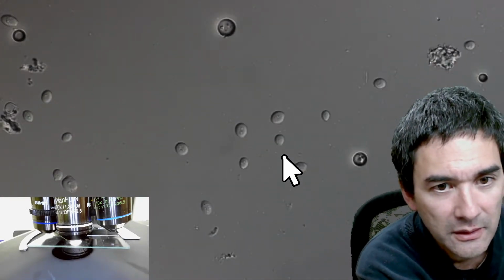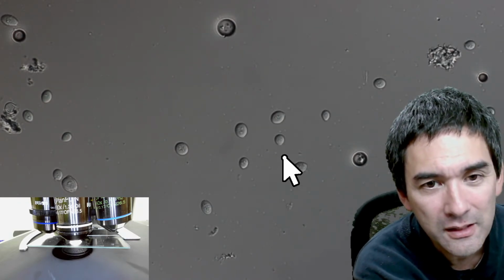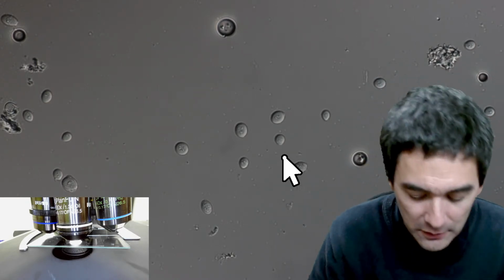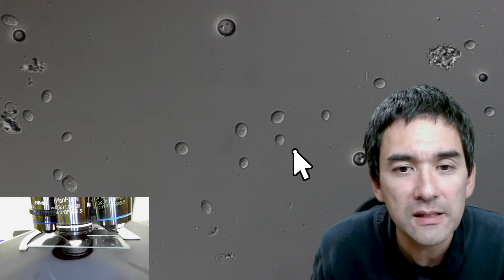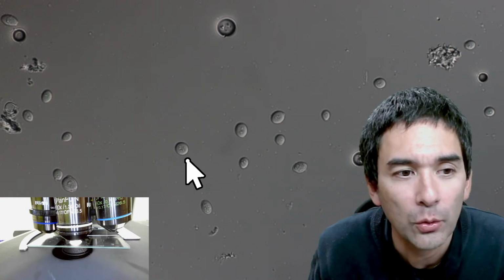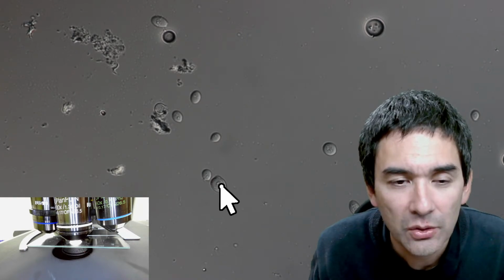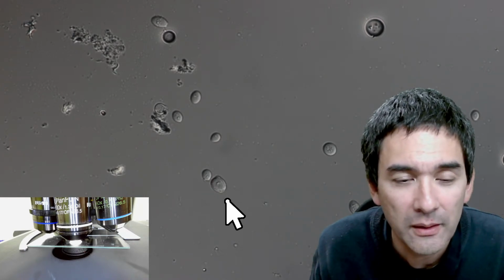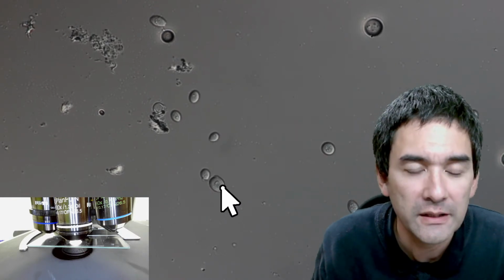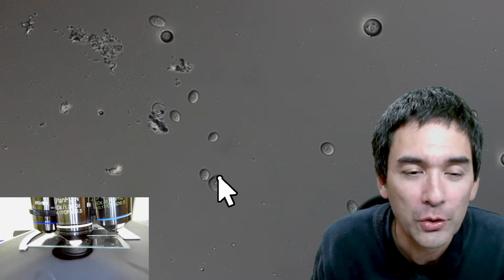Yes. Actually, I think, look, the shape is different here. The yeast cells, they don't like the oil so much, right? If you look carefully into the yeast cells in here, you might actually see some dots. These are cell organelles. Yeast cells are eukaryotes. This means they have a nucleus, they have mitochondria and so on, barely visible here with a light microscope. But if you have an electron microscope, I don't have one, then of course you're able to see that.